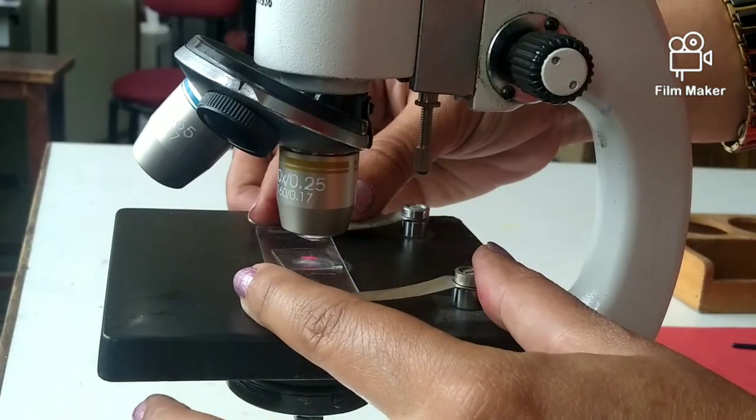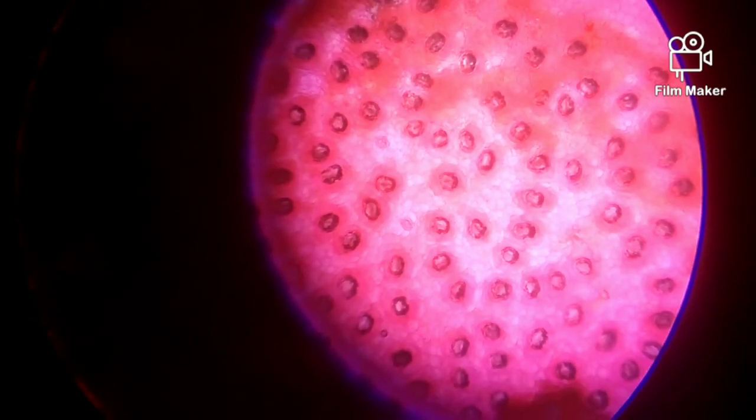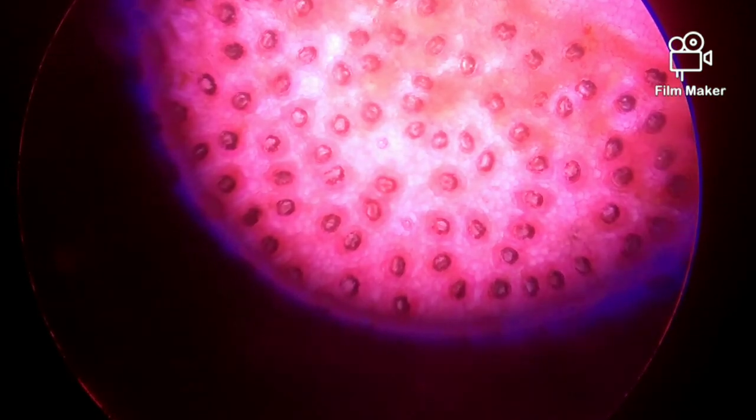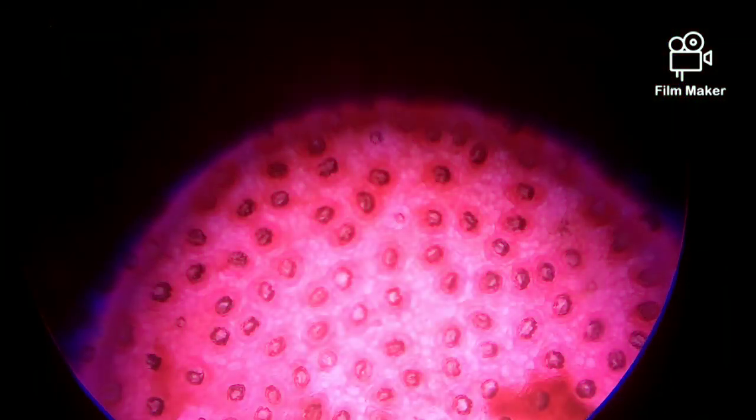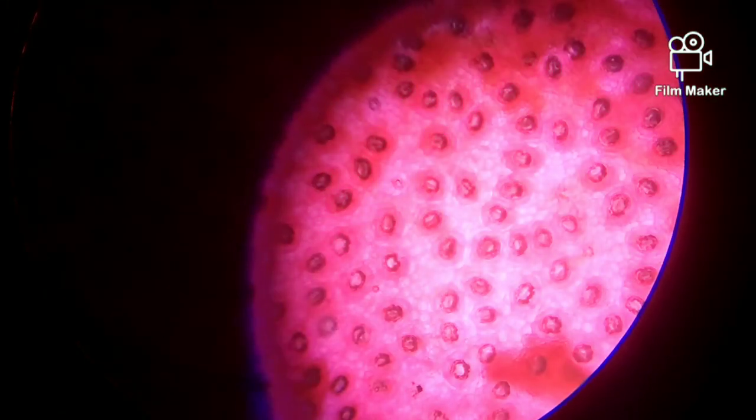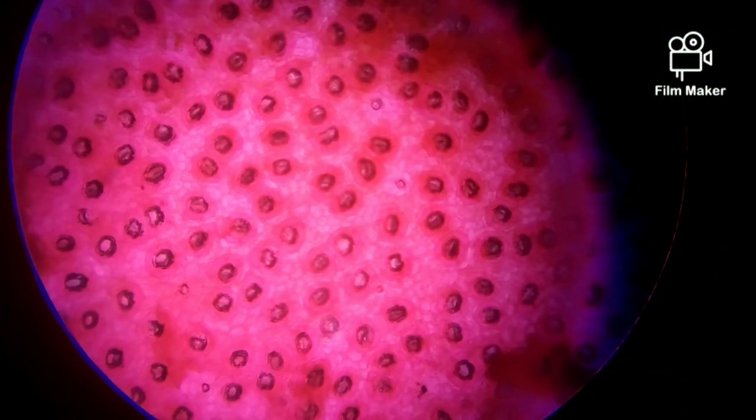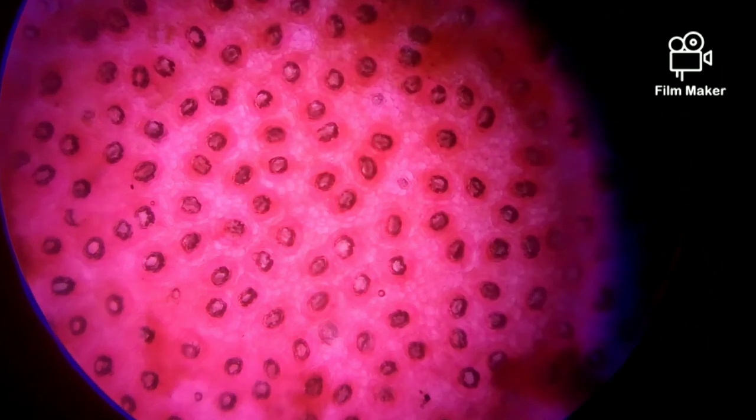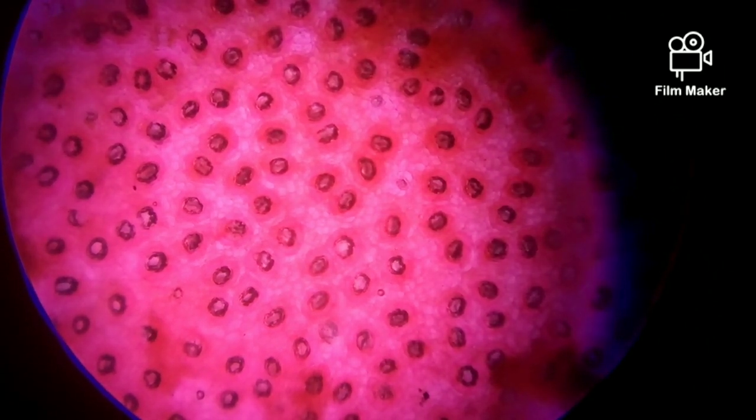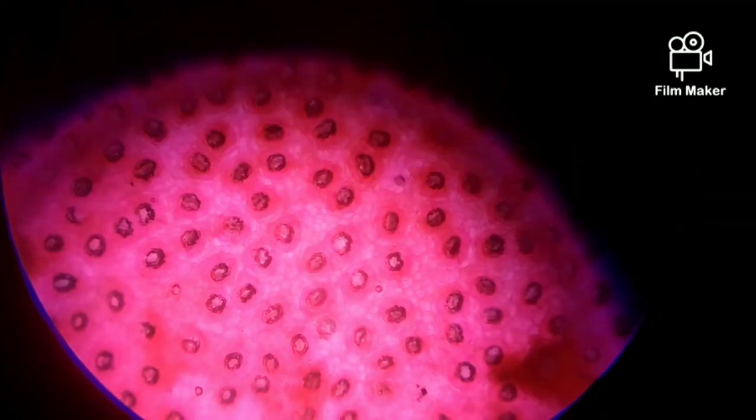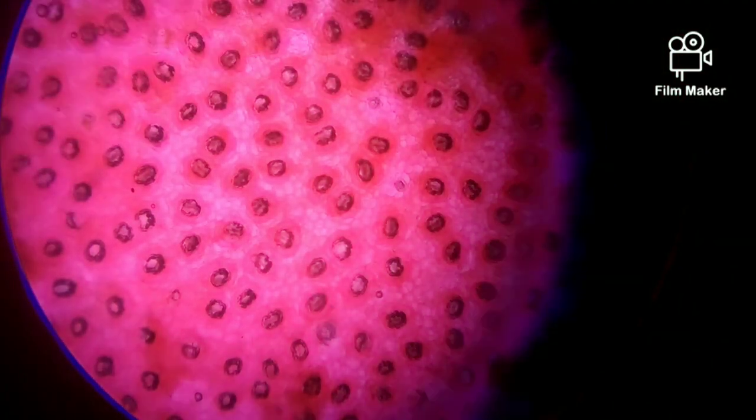Now hold it with these clips. See the small openings, stomata scattered through the epidermis. Now see the different views. It's amazing to see more than a hundred stomata in a small specimen.